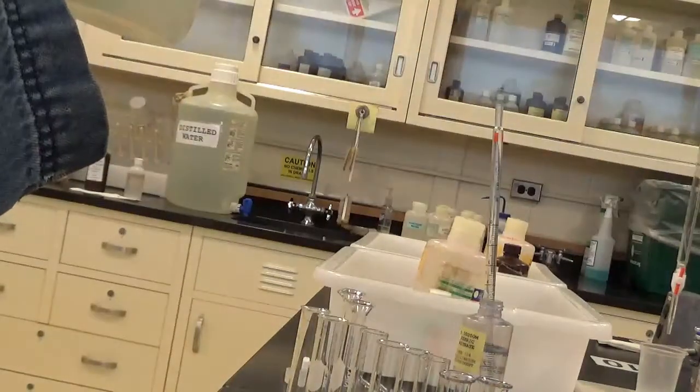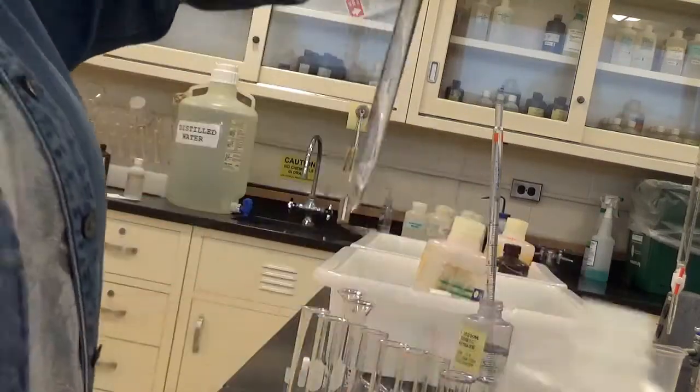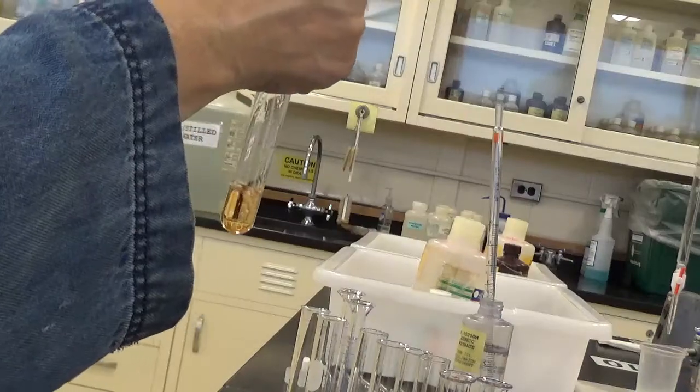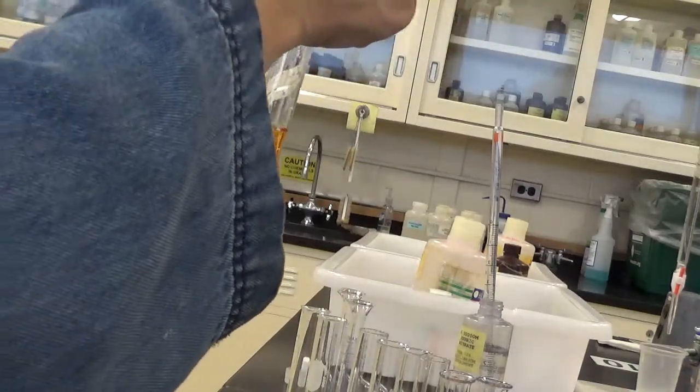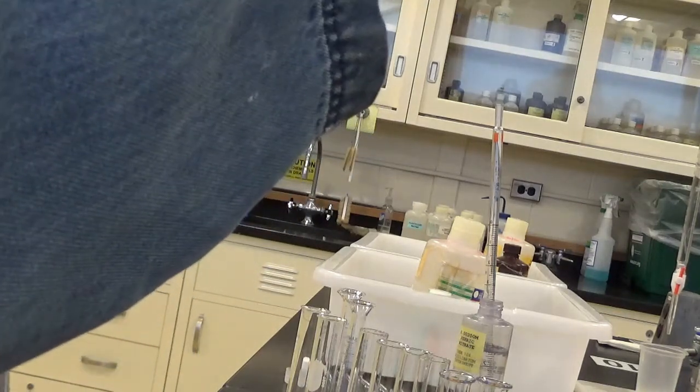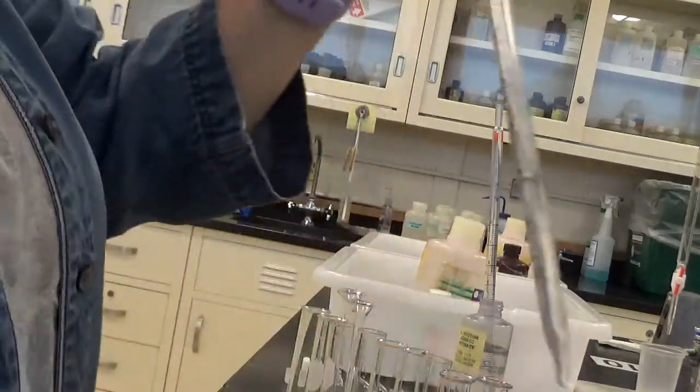So for 7, I'll go from the 1 milliliter to the 8 milliliter mark. 6, 7. I'm going to get 8.